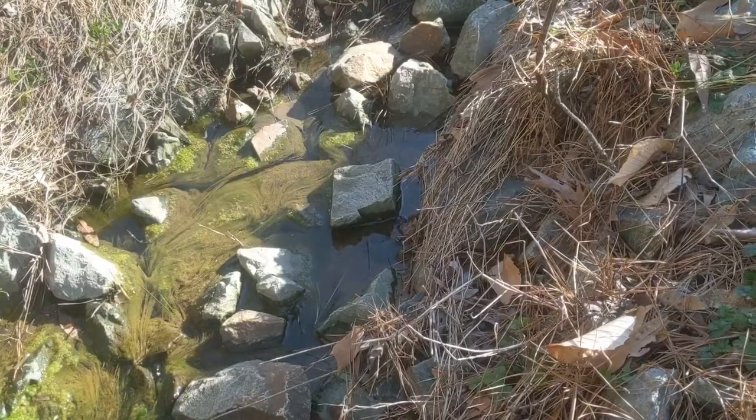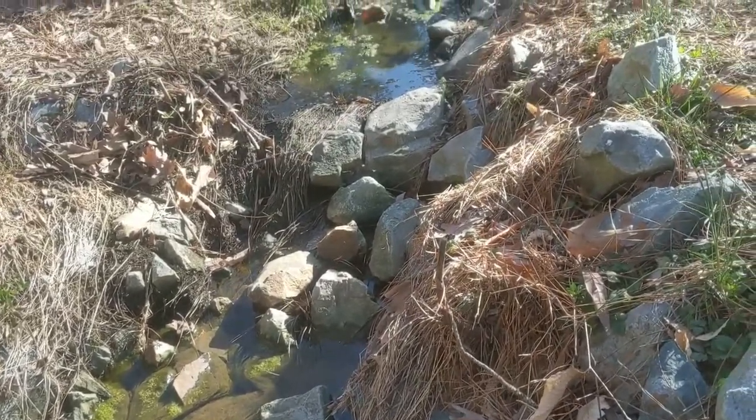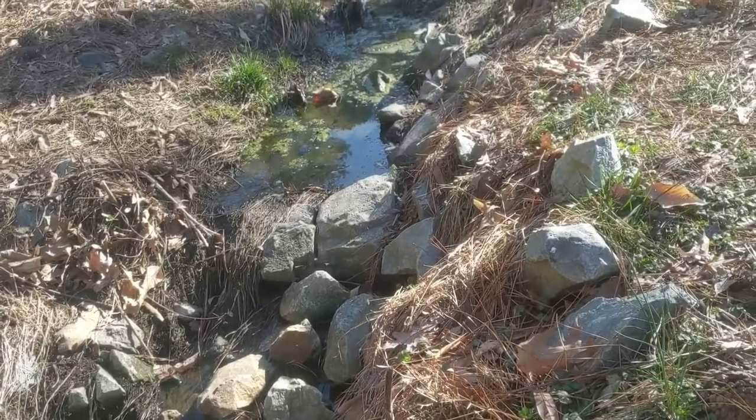When you get down there, the first thing you need to do is survey the area, take a picture, and establish what is upstream and what is downstream. The water flows from uphill to downhill, right? So upstream is up the hill. If you're looking upstream, the water should be coming at you. If you're looking downstream, you should be watching the water flow right past you, going that way.